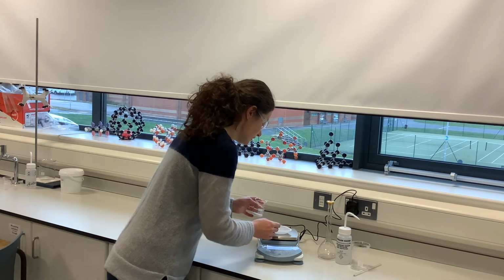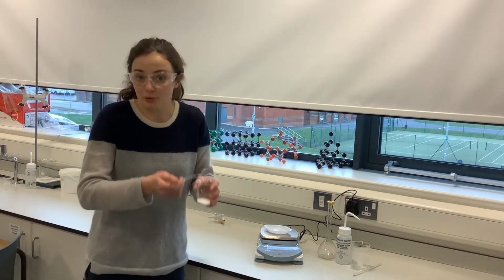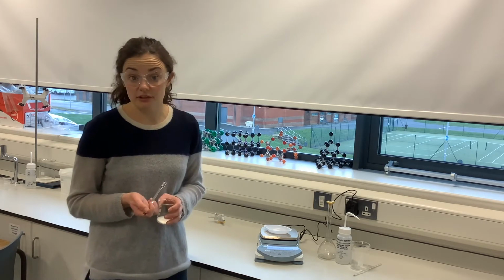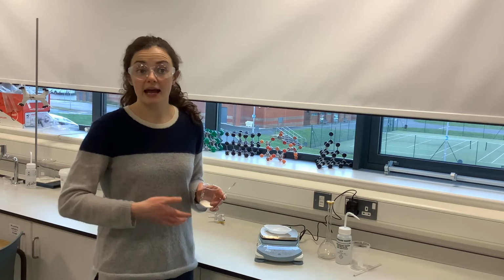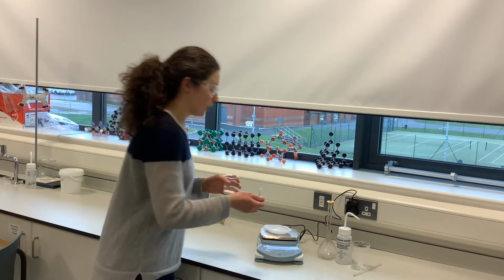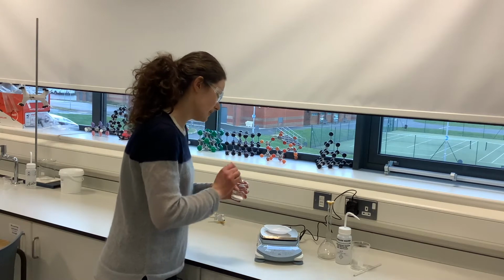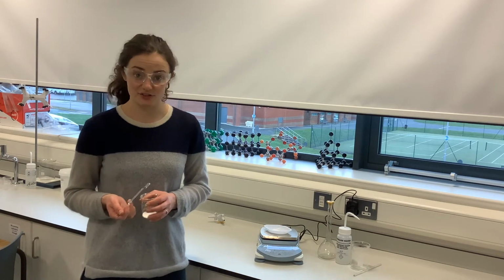Okay. And again, if the question said accurately approximately 2.86, right now it's at 2.87 grams, so I could just say, okay, that's close enough to what they have asked me to approximately measure out, as long as I record that that is the mass that I've used. But because the practical actually tells me to measure out 2.86, we'll go for that. So that is it, right on 2.86 grams now.